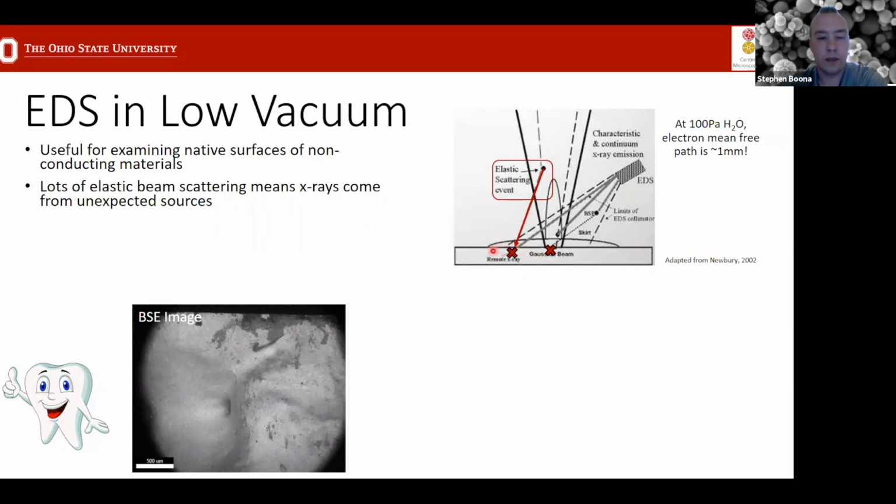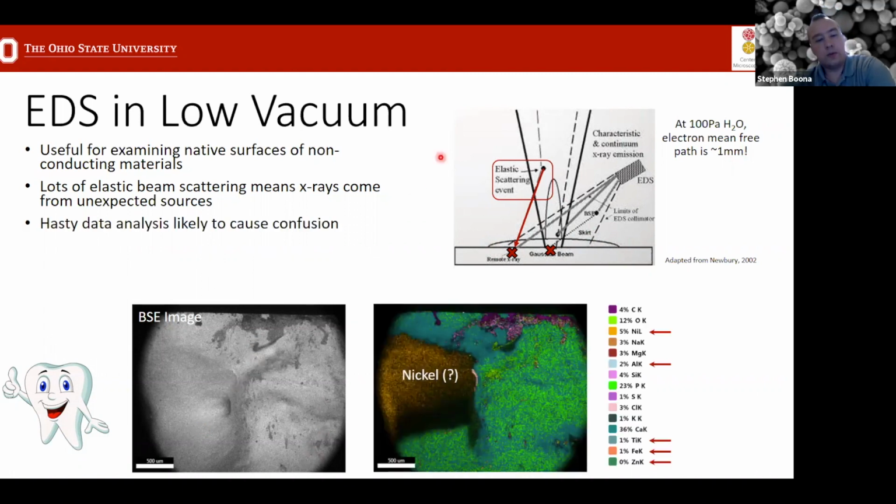That area is described by this term they call a skirt. Depending on the parameters you use for your data collection, this can potentially be millimeters away, so that is outside the field of view of the sample in this image. What that means is that if you do your data collection and analysis, you can see things that surprise you and don't really seem like they make sense, depending on how carefully you scrutinize the results.